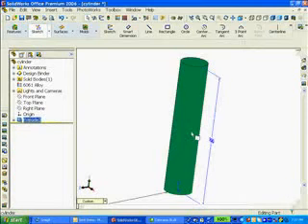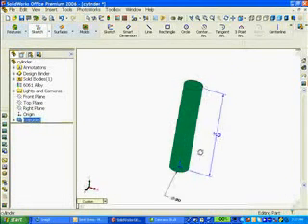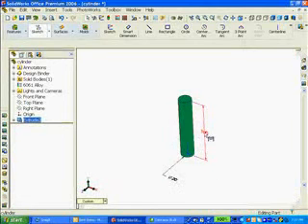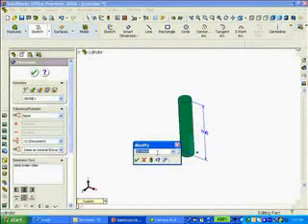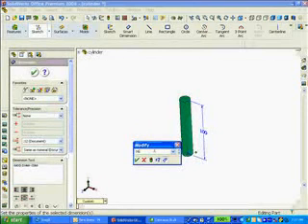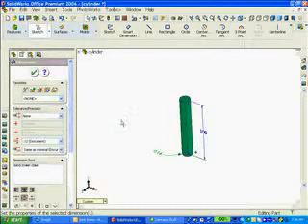To begin with, we have a cylinder, but in our design, I'm going to double click on the cylinder and change a few dimensions. We have 100 millimeters, so that's okay, but the diameter needs to be 16 millimeters. I'm going to double click on the diameter dimension 20, enter 16, and then say rebuild. The millimeter units is selected because that is the default of my document template, and then I will say OK.